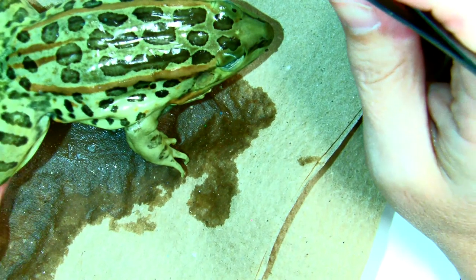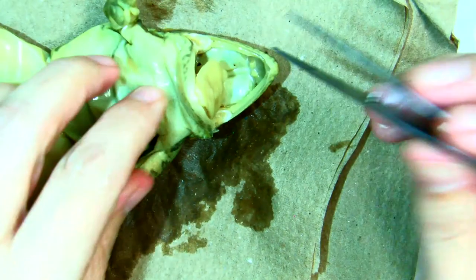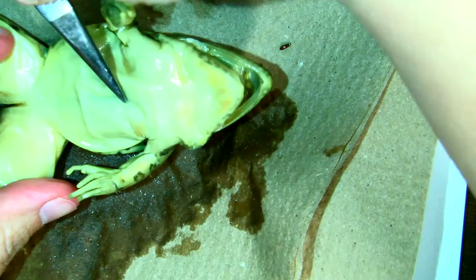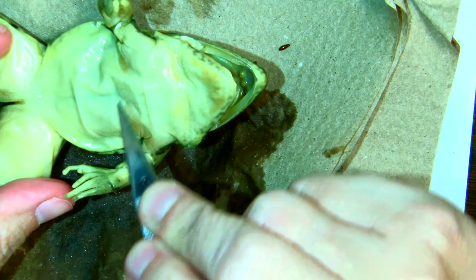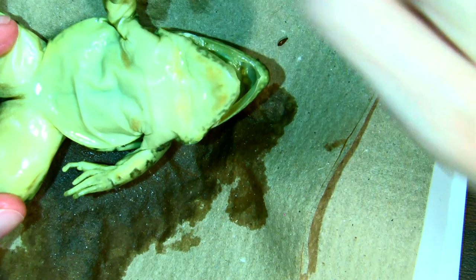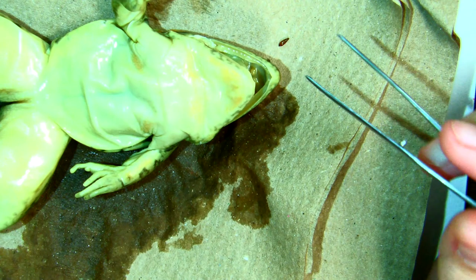And that's really all we're going to look at on the outside. Tomorrow, we are going to do a long incision here, and off to the side. And then open up and look at internal organs. And if there's extra time, you can take a picture as long as you're following directions.